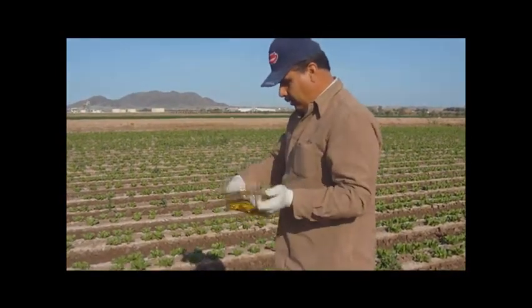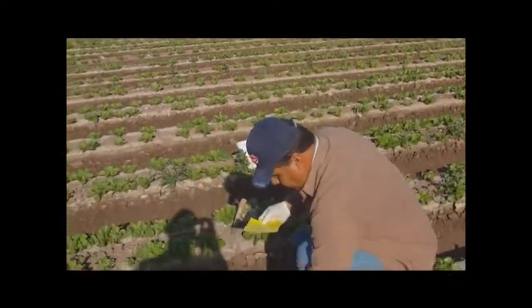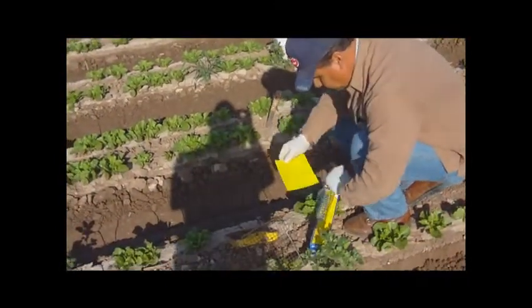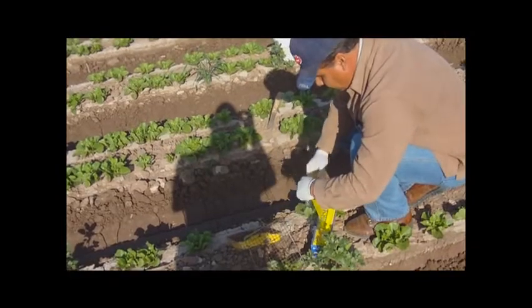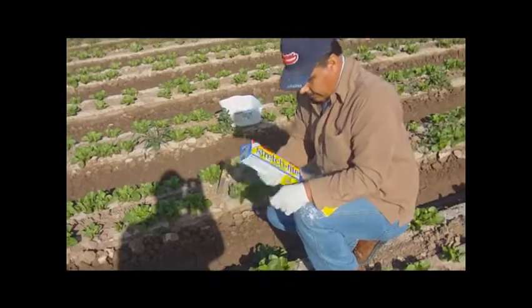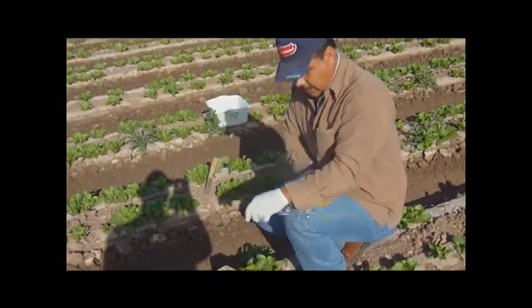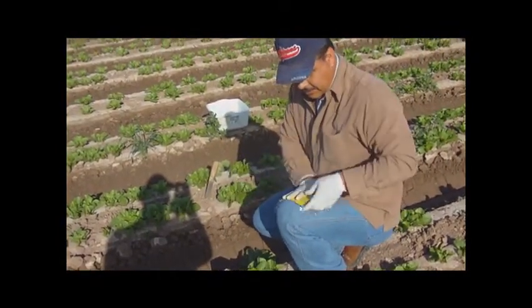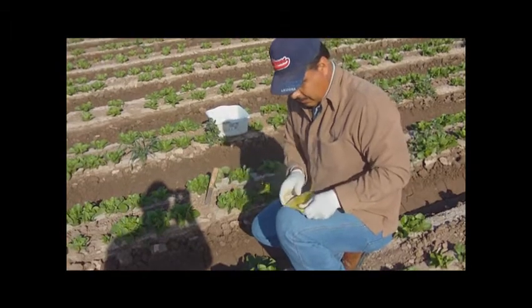Once we've done that, we'll go ahead and bring the trap out. Get our stretch-type plastic wrap. We'll go ahead and wrap it up, kind of stretch it maybe once or twice. That'll kind of stretch the plastic a little just to make it look nice and good.